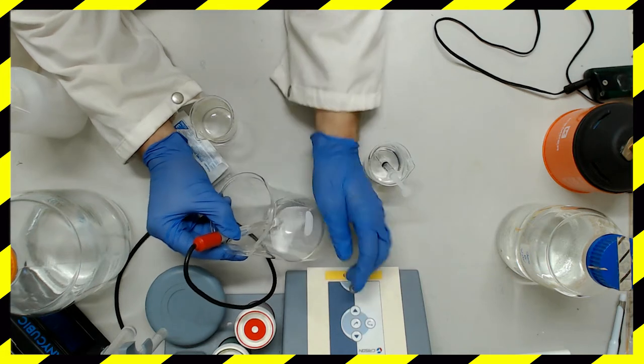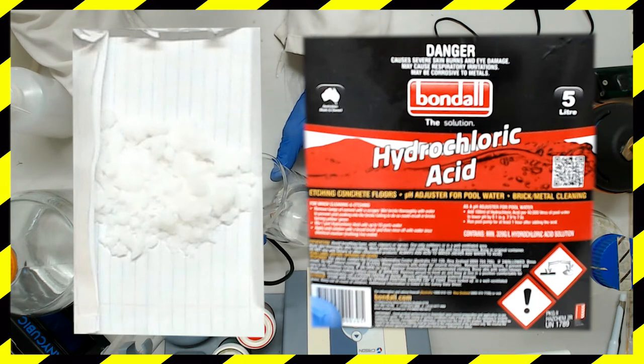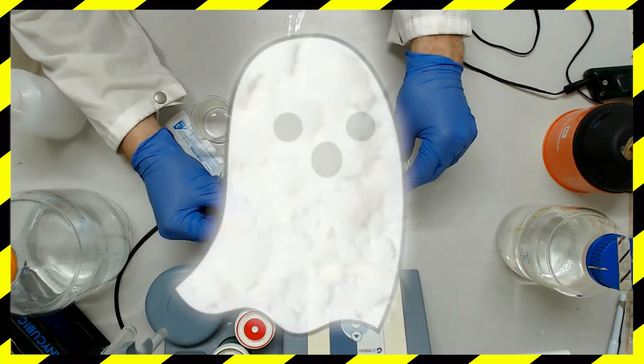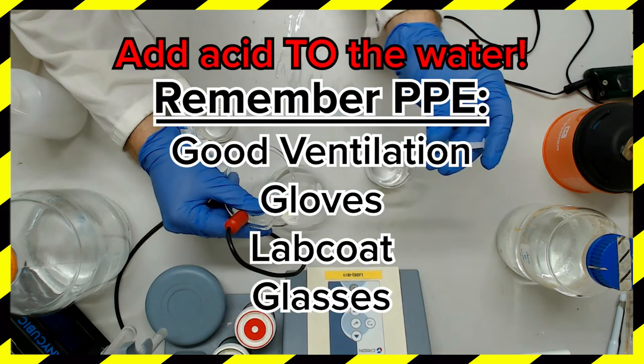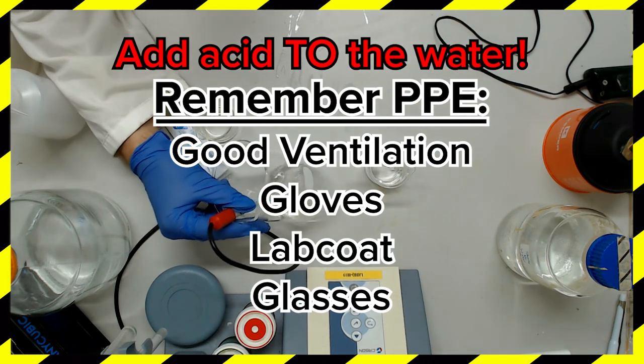If you're following the video series in order, you've already worked with Trisbase and concentrated hydrochloric acid. Check out the first video if you've forgotten. Just because you aren't working with the spooky salts from the last two videos, doesn't mean you should relax on the PPE. Especially while adding acid to the water, wear your gloves, lab coat and goggles and work in a well ventilated area.